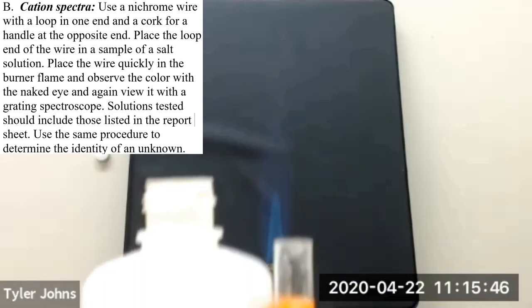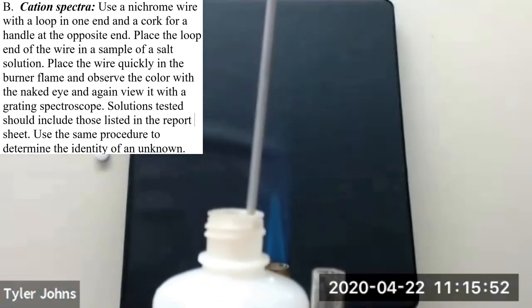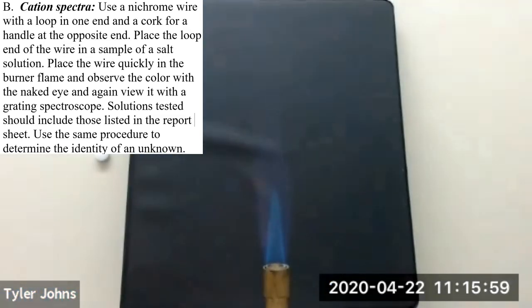The second unknown cation spectra we'll be looking at, unknown number 2, we'll place our nichrome wire into unknown salt solution number 2, and then place it in the flame.